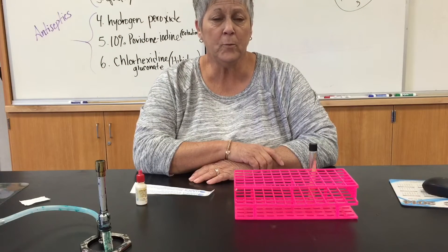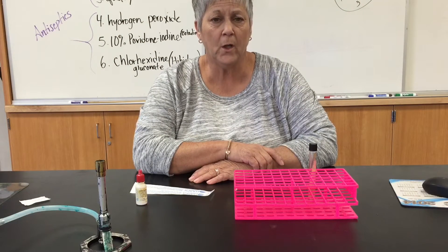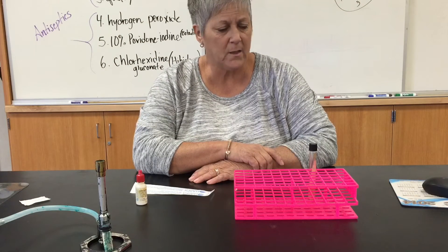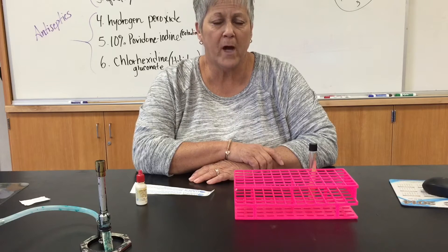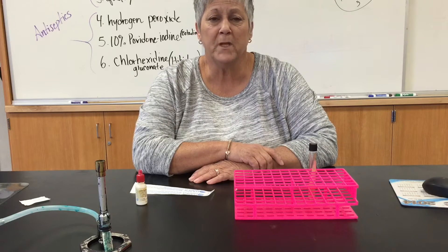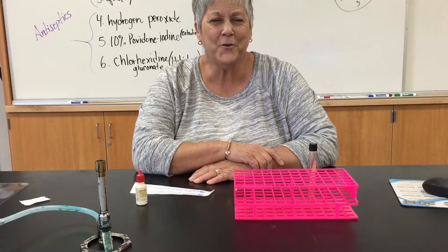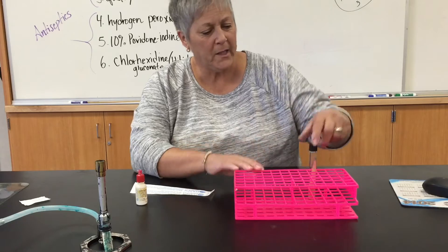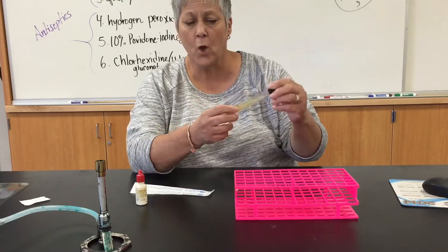Hi there. Professor Schimold with a demonstration of the phenylalanine test, testing for the ability of a microorganism to metabolize an amino acid called phenylalanine. This is phenylalanine test agar.